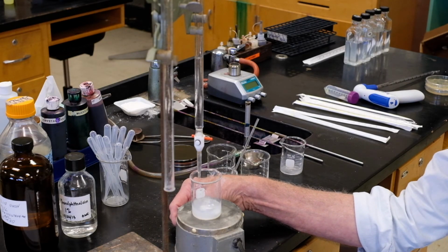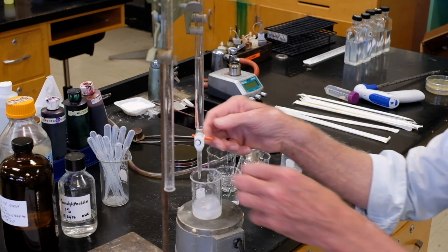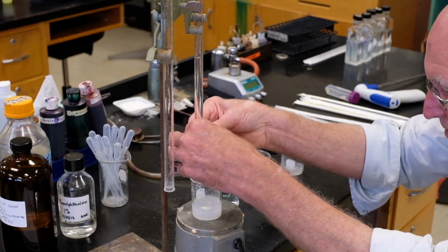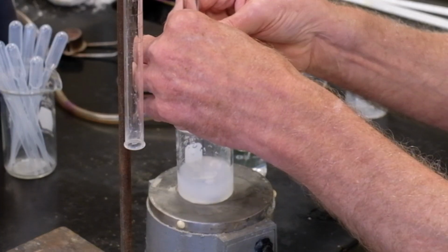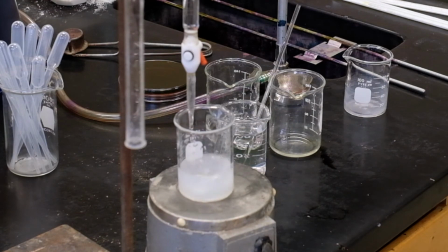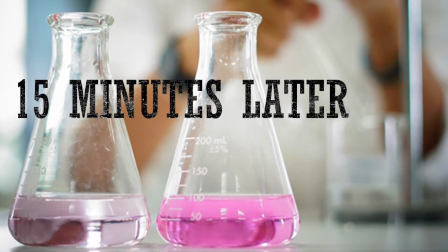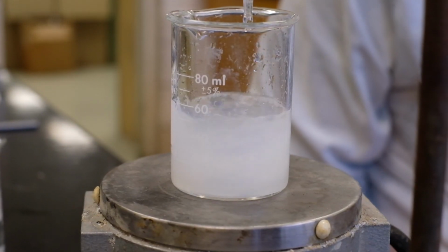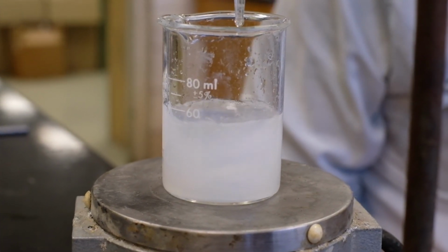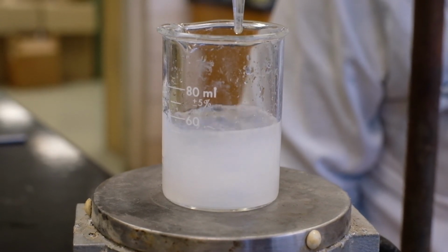The faster I do it, the faster it gets. Don't drop anything. All right, let's get these drops going here. Normality NaOH times 9.